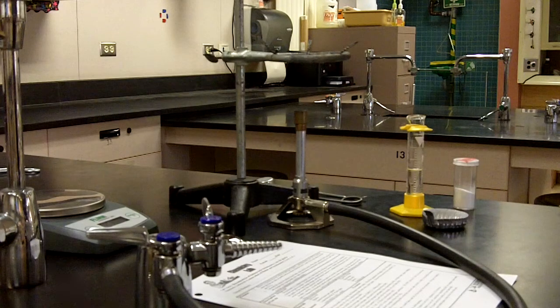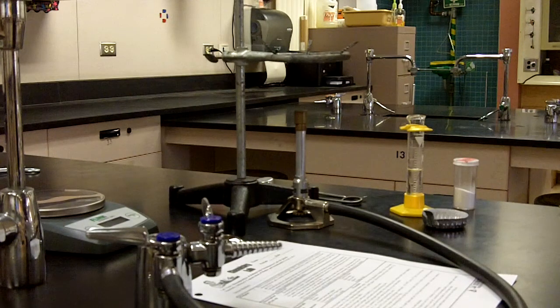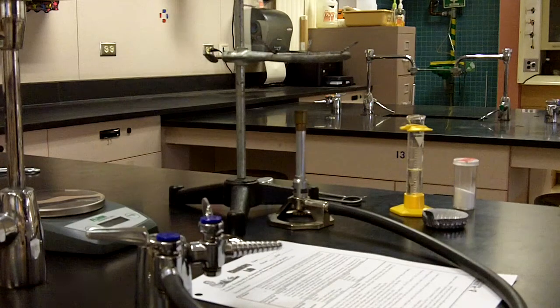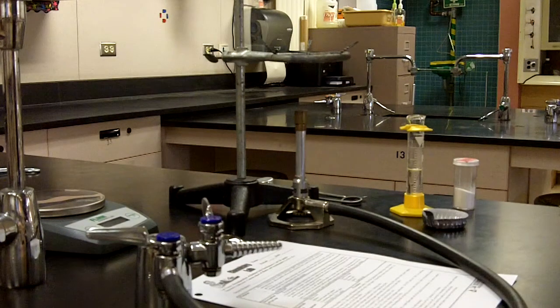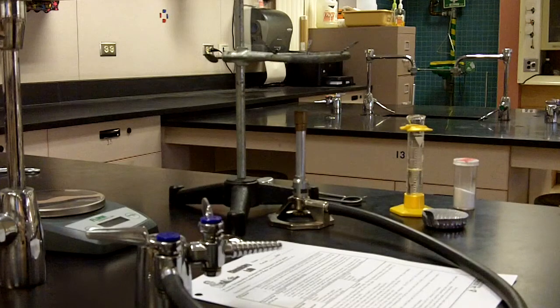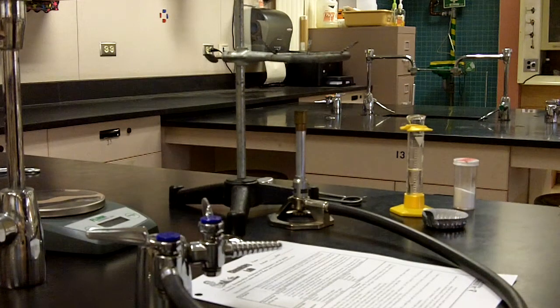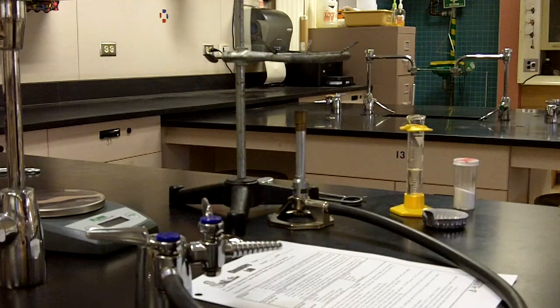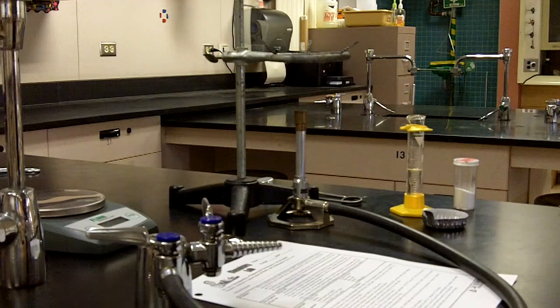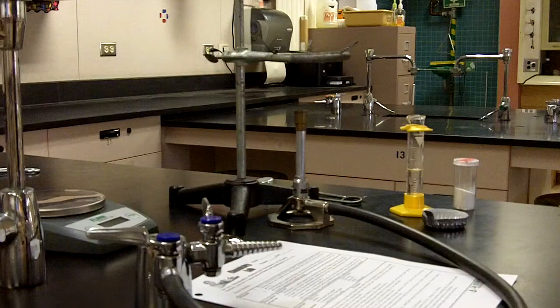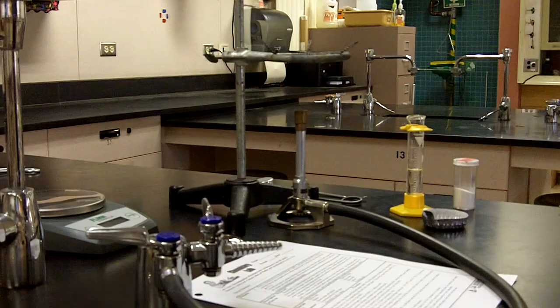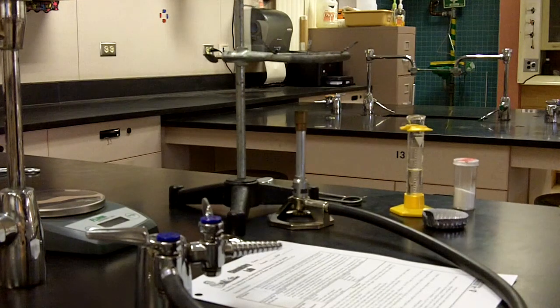To produce materials that are safe to handle such as sodium chloride NaCl, water H2O, and carbon dioxide gas CO2. 2. Calculate the moles of sodium bicarbonate used and the moles of the solid product NaCl produced, and compare the experimental mole ratio to theoretical stoichiometry predictions to determine if a reaction occurred.